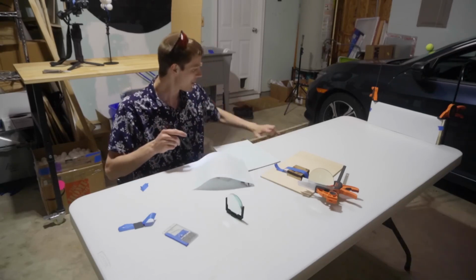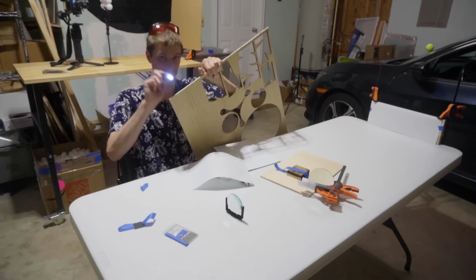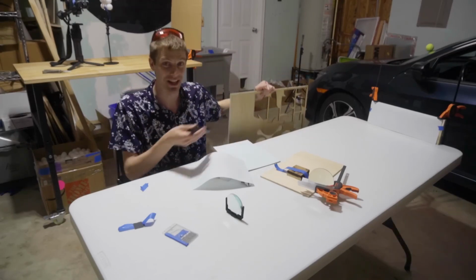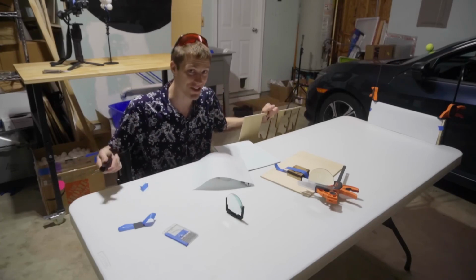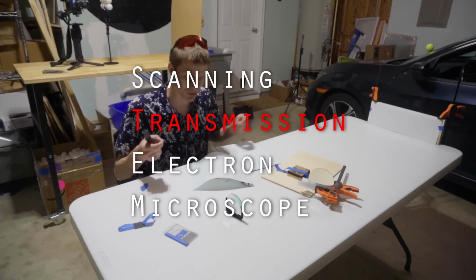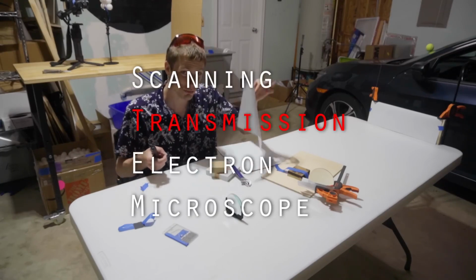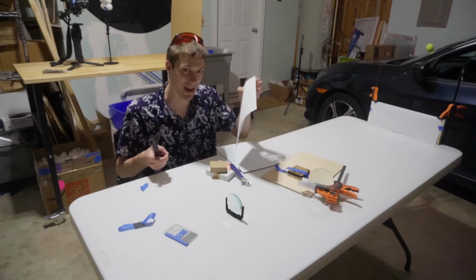But now, imagine trying to shine a light through a piece of plywood. It's just not going to work. They're both cellulose, but one is a lot thicker and a lot denser. So when you're trying to make a transmission sample that you can shoot electrons all the way through, it needs to more resemble a sheet of paper, except a bunch of orders of magnitude thinner.